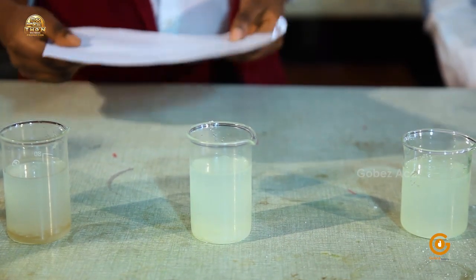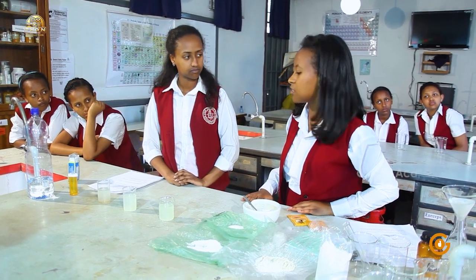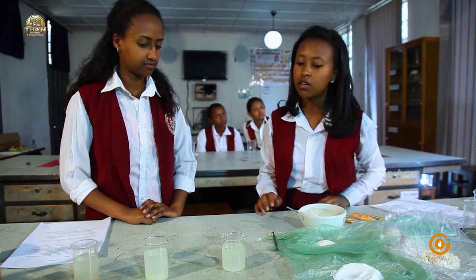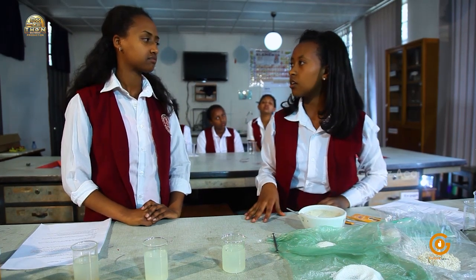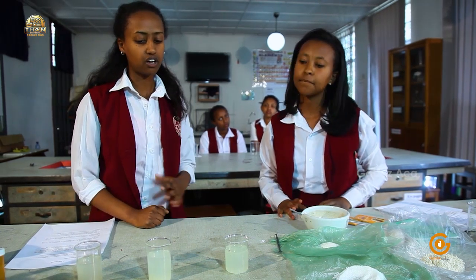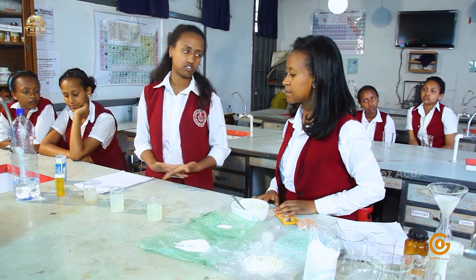How does stirring affect how fast sugar dissolves? The way that stirring affects is that when you stir, you're distributing the sugar molecules to the lemonade uniformly, so the solubility rate increases and the sugar dissolves. Okay, I think as you said, because of that, I didn't stir the solution in my beaker, and this one, because of collision, still there is suspension.